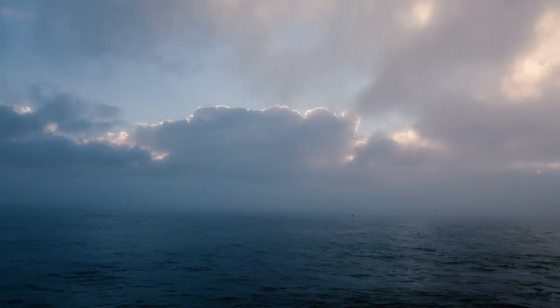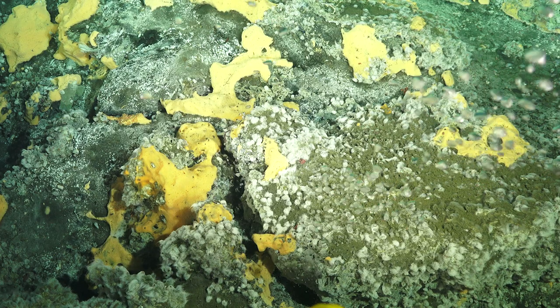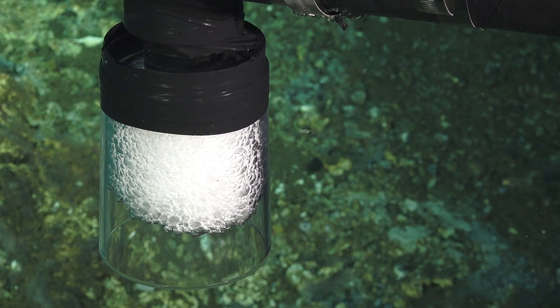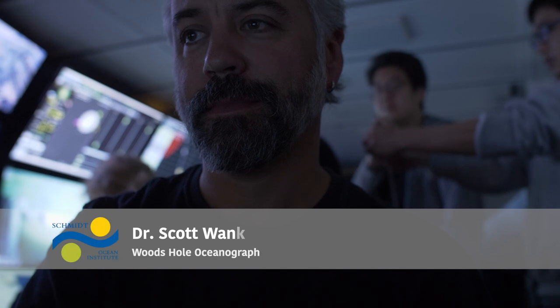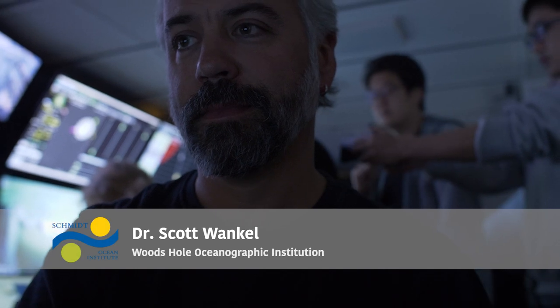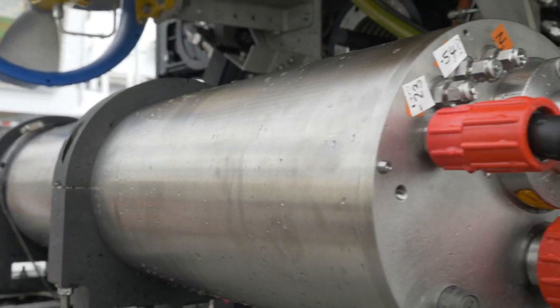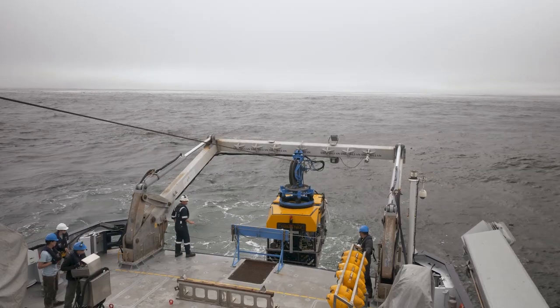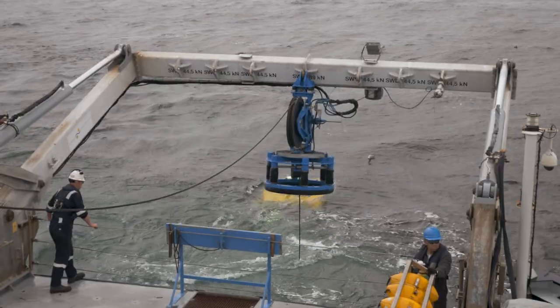Through a highly specialized interface called a membrane inlet, we're letting in small amounts of gas — in this case, gas from bubbles that we capture and transfer while on the seafloor. Here we're looking at data streaming in from a deep-sea mass spectrometer that's mounted on the ROV on the seafloor. This mass spectrometer measures the relative abundance of gases in the seawater and in the bubbles as they're moved past the membrane inlet.